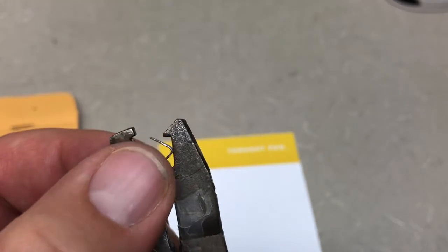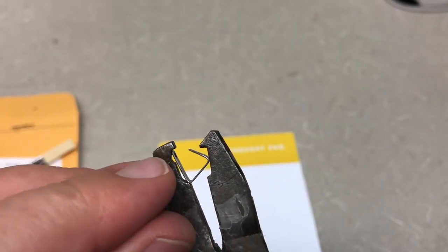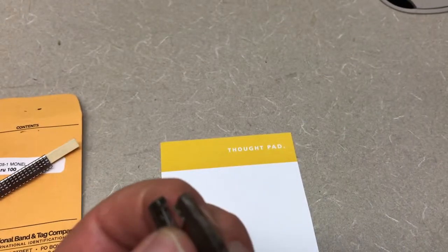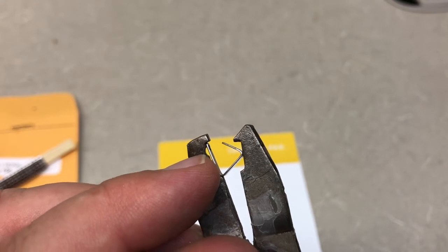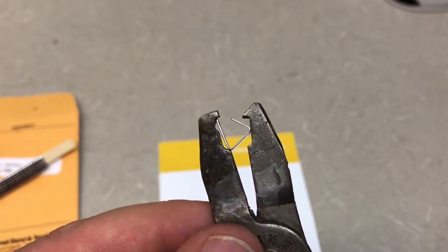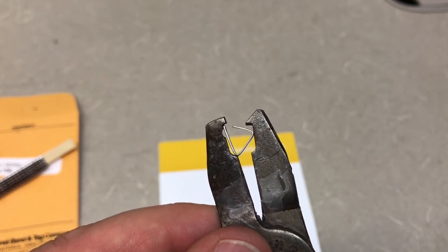Here's how we're going to put this on. Notice I've got the end of the long side inside the divot at the point there. If we check, we can see there's the hole and it's lined up over the little divot on that side. You can see that as I apply pressure, that piercing point is going to go through.